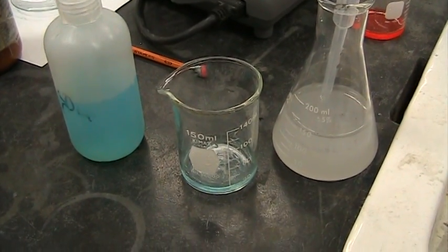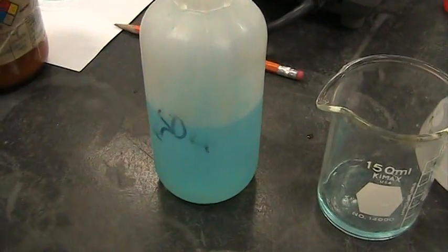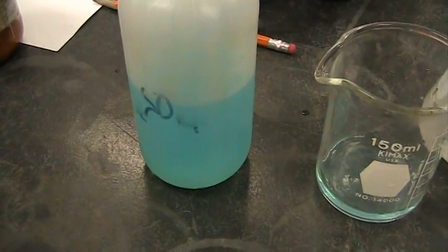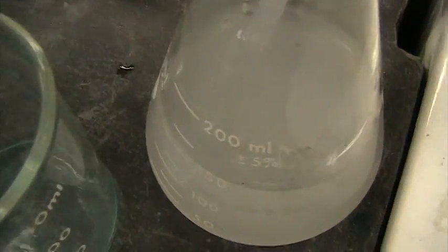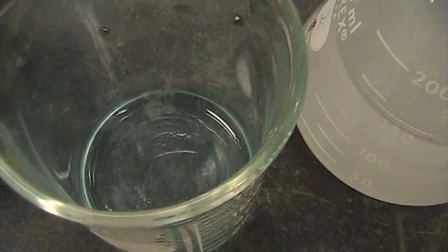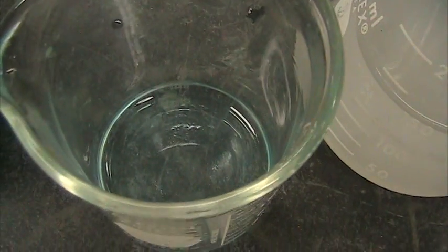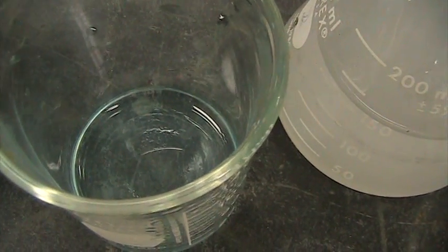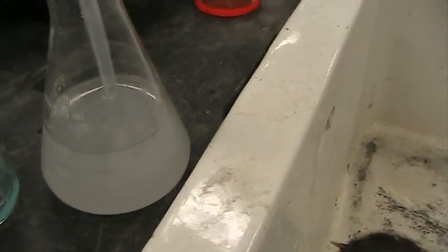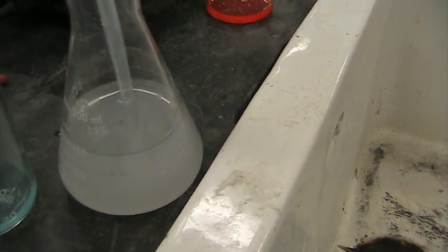Okay, here we're going to look at a reaction between copper sulfate, this blue liquid. We formed a solution with the blue copper sulfate crystals placed in this small beaker. It's a clear blue solution with this kind of cloudy barium chloride solution.